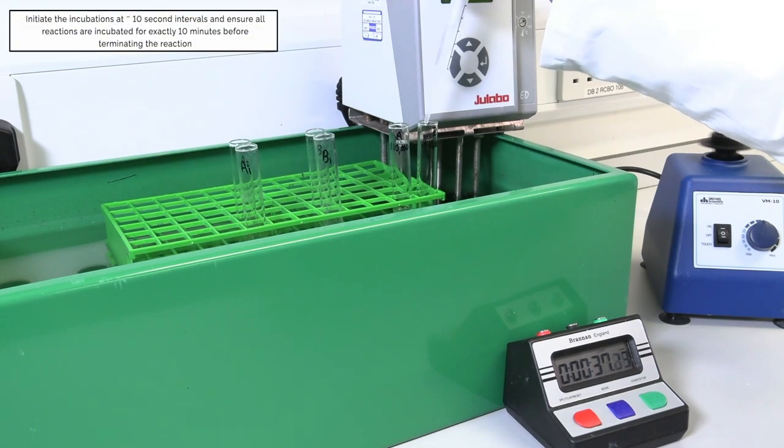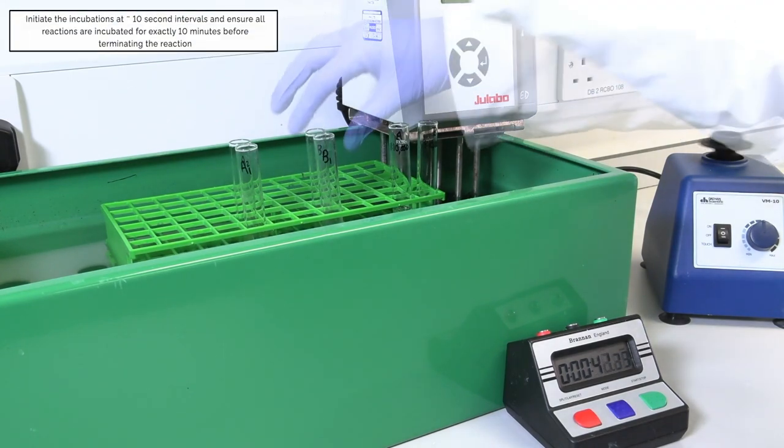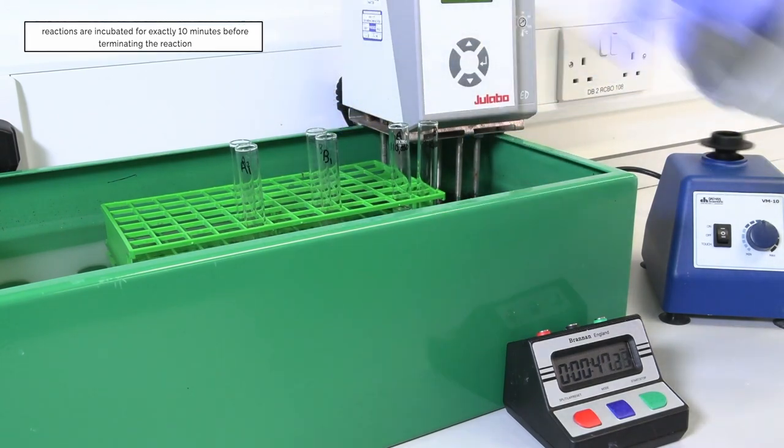Initiate the incubations at approximately 10 second intervals and ensure all reactions are incubated for exactly 10 minutes before terminating the reaction.